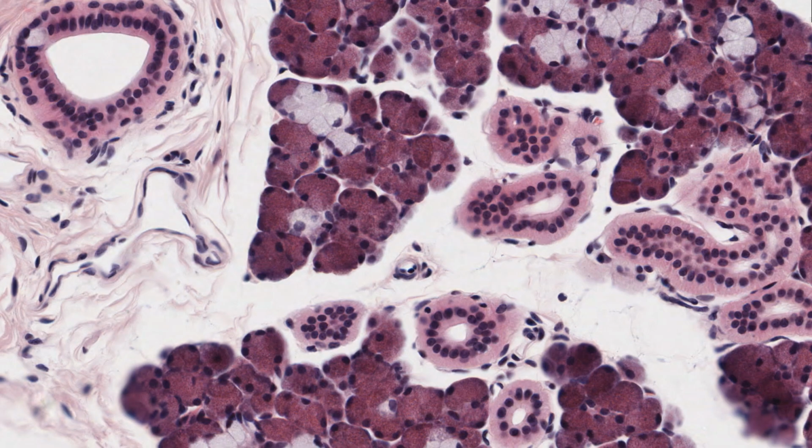Cells are usually described as being squamous or flat, cuboidal, columnar or tall. In some specific tissues, such as exocrine glands, the secretory epithelial cells may occasionally be referred to as being pyramidal, with their apex adjacent to the lumen of a duct. So this epithelium here, and again here, would be called simple cuboidal epithelium, because the cells are most likely cuboidal, having nice round nuclei.